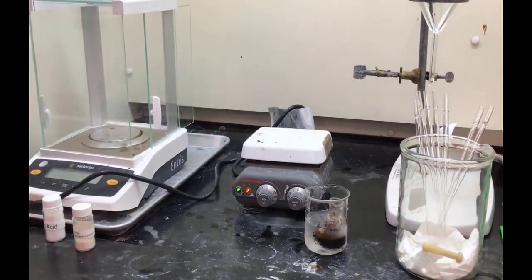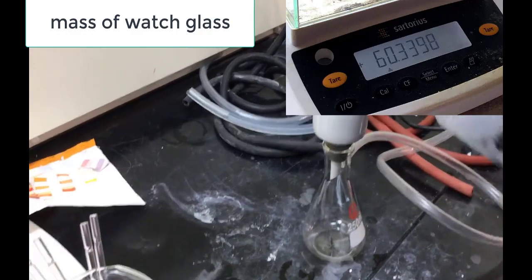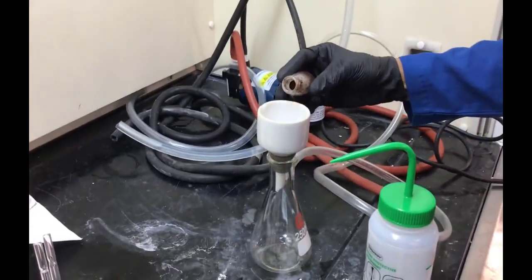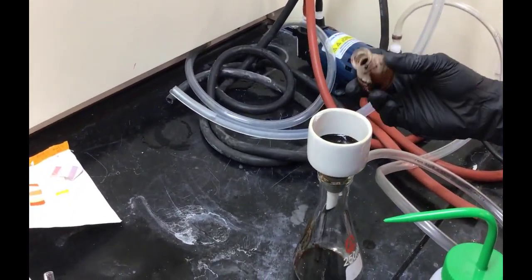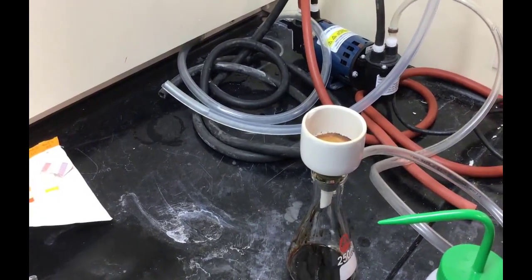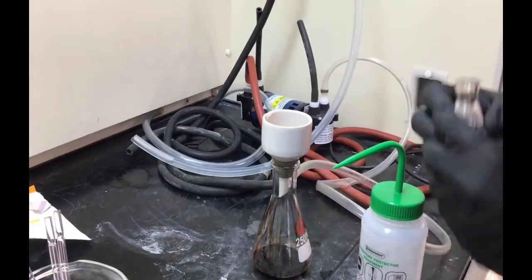All right, and once it has been in the ice bath long enough, they are waiting for that. While they were waiting for that to happen, they weighed out a watch glass and filter paper, and that picture we just saw in the top right hand corner of about 60 grams, that was the total mass of the watch glass and the filter paper. So they put the filter paper in the Buchner funnel, added their azo compound mixture so that they can filter off the solid and collect it.